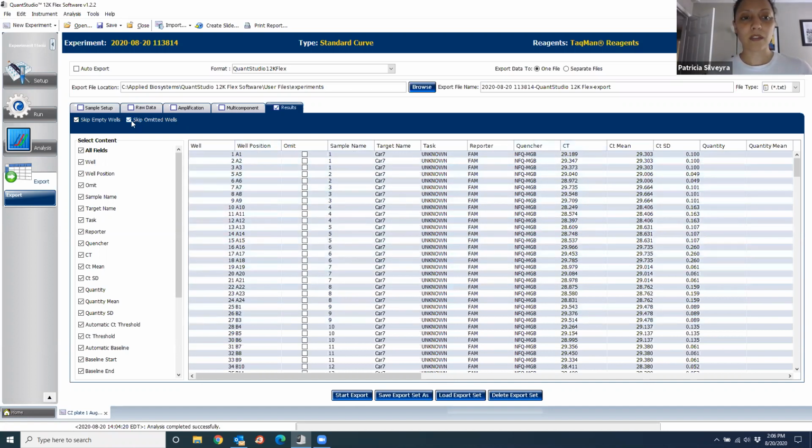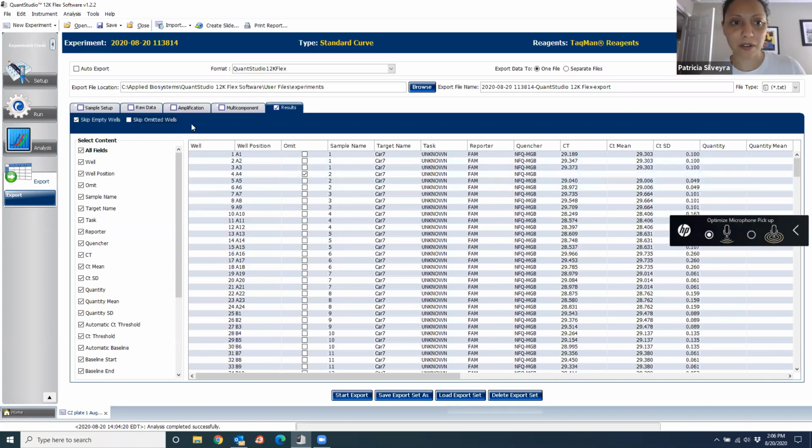So the only thing that I am going to tell you to remember to do here is to unclick this. This says skip the omitted wells. What you did in the prior step is you removed those wells that had crazy amplification plots. So when you skip this, it puts everything together. When you remove it, it leaves the empty space. So I don't know if you can see here what happens around here. Concentrate here, for example, in A4. See how it just goes away and comes back. So now I want this space because I want to be able to tell the PI that I omitted that well. Otherwise, it just gets rid of it and you are not going to remember what happened.